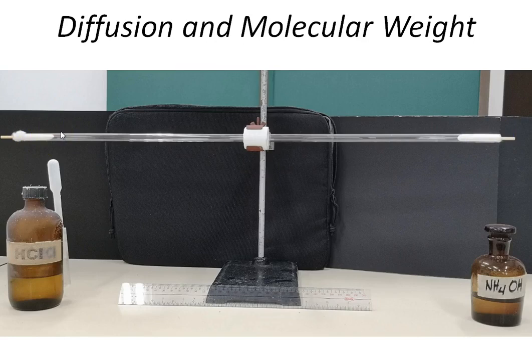If we were to do this in the laboratory, one very important precautionary measure that we observe is that we are careful when it comes to hydrochloric acid and ammonium hydroxide, because these are both very caustic or volatile reagents. They can cause severe burns and damage to your clothes.